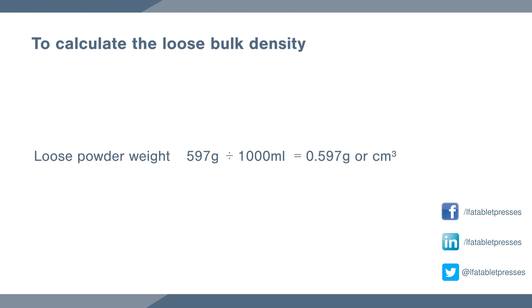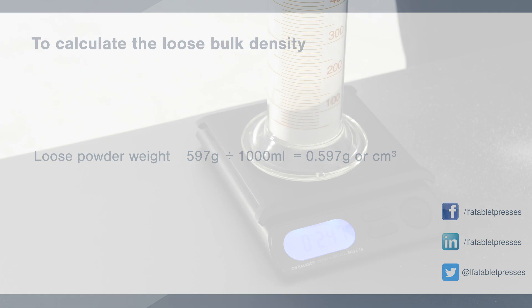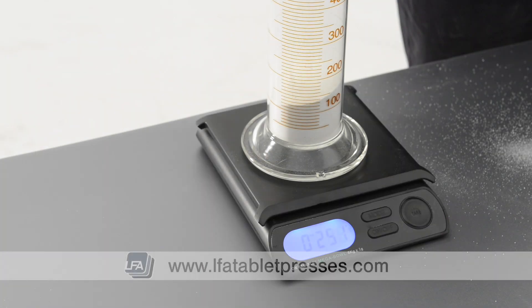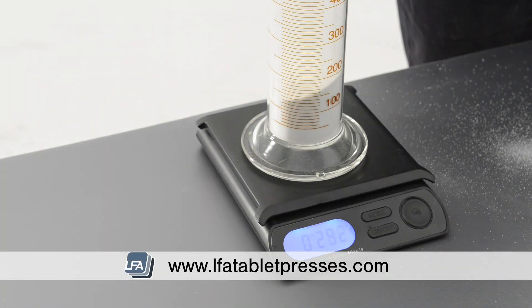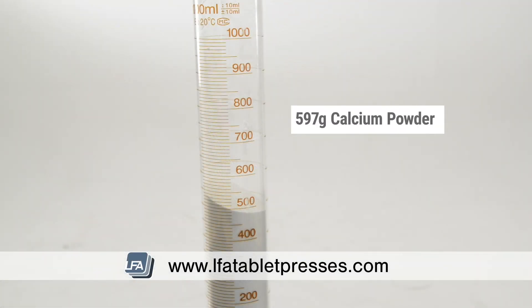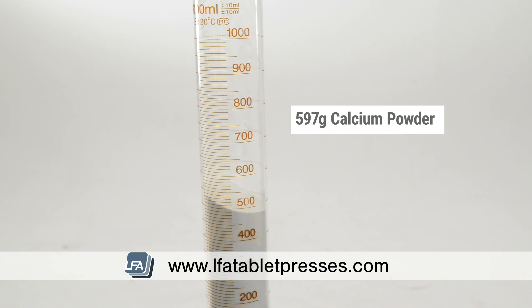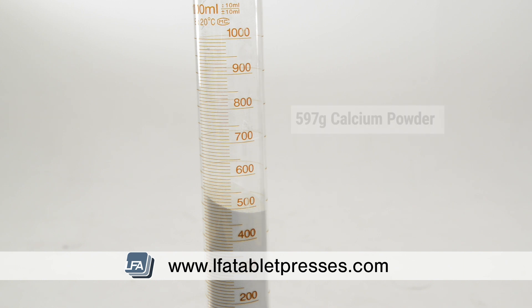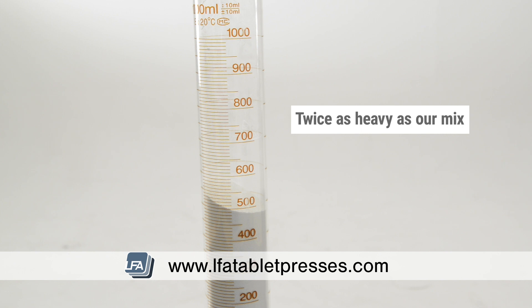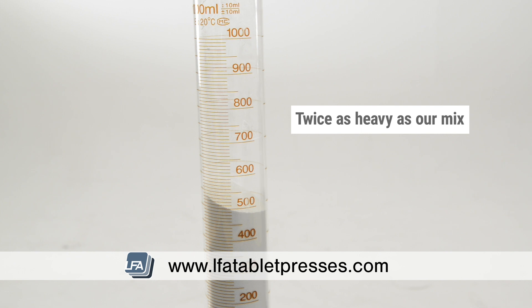This can be used to calculate the weight of a tablet depending on the size of the die. As an additional example, this is 597 grams of a different product. As you can see it shows the major differences between products — this powder will be able to make a tablet twice as heavy with the same amount of powder as compared to the last one.